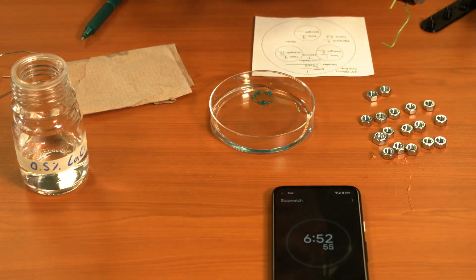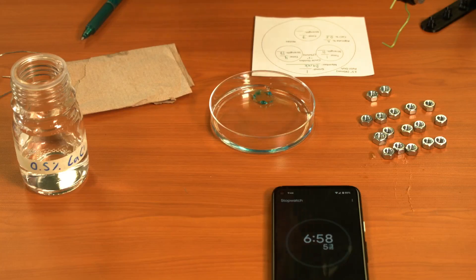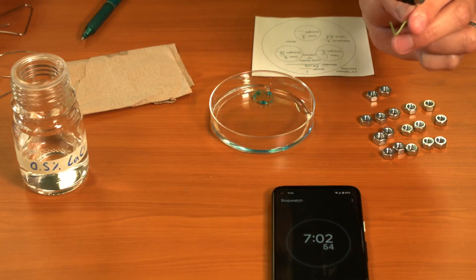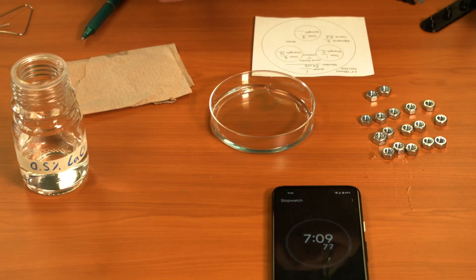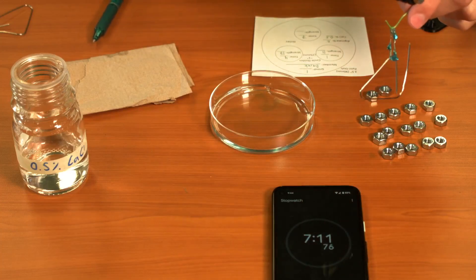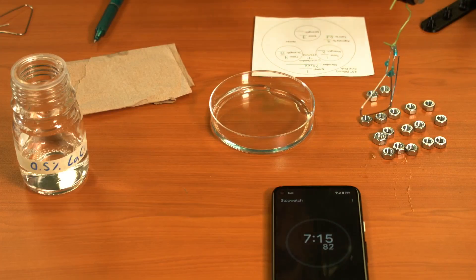I might get ready with a second paperclip here. I might not need it, but we'll see. Alright, so that's seven minutes. Let's go ahead and get our main clip.